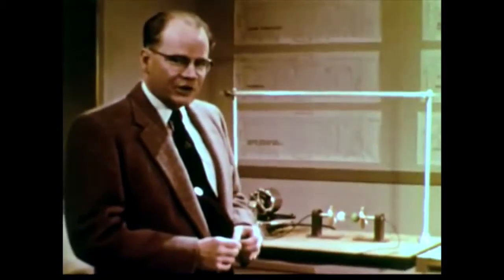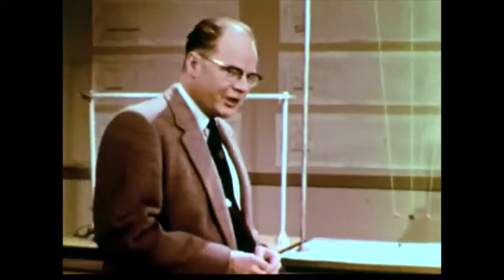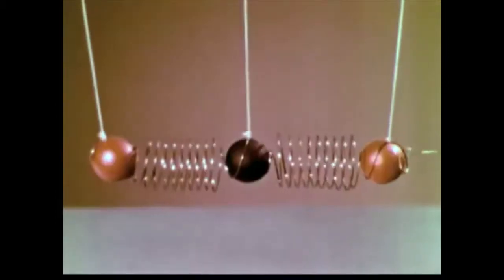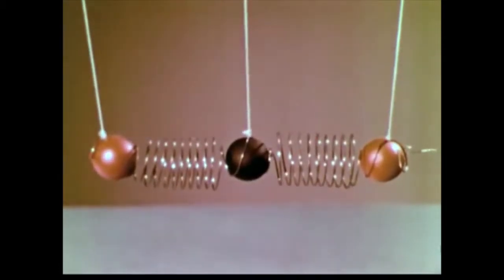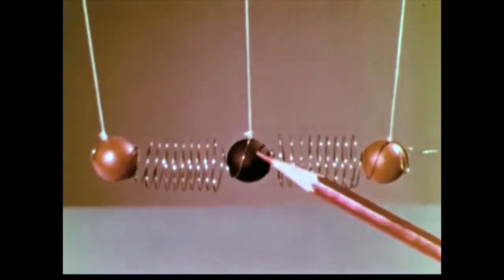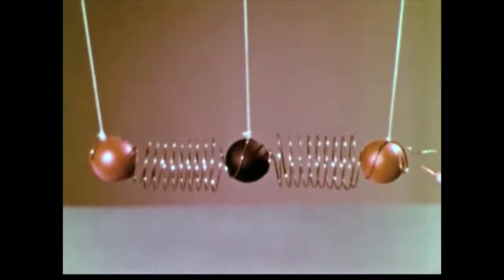Now we've seen how a diatomic molecule produces its typical infrared vibrational spectrum. Let's go on and consider what happens in the case of polyatomic molecules. We can learn something about their vibrations by the use of a model of the carbon dioxide molecule. The center sphere represents the carbon atom, and the oxygen atoms are on each side. We activate the model by using a motor-driven eccentric, which is coupled to the molecule by a very loose spring. Of course, if this were a real molecule, it would be pushed on by the oscillating electrical field of the light wave, just as we saw in the case of the HCl molecule.